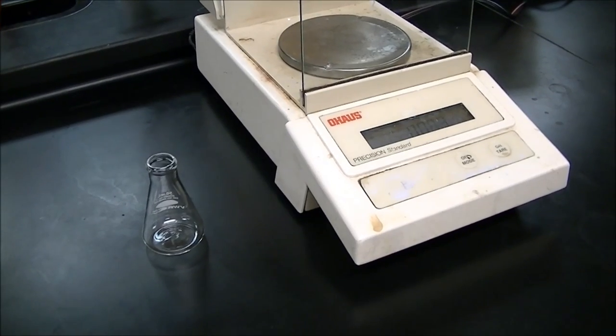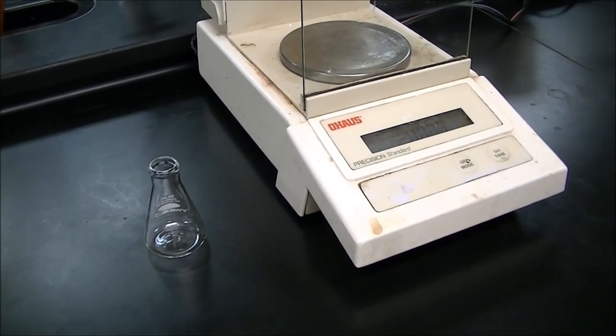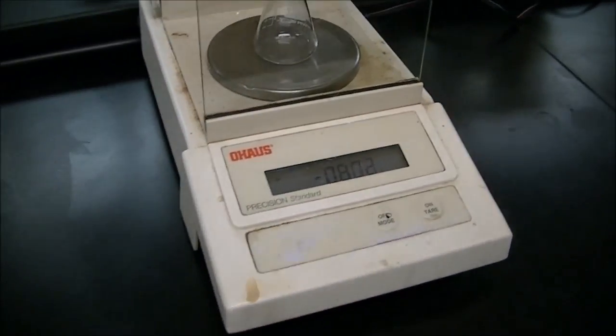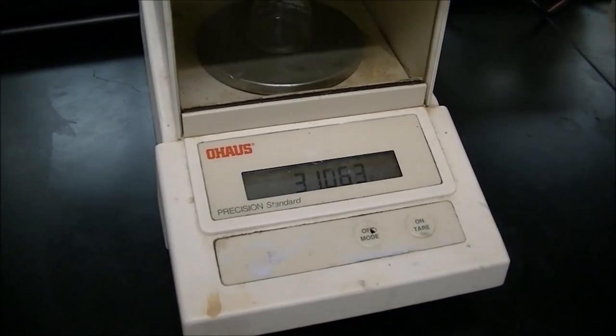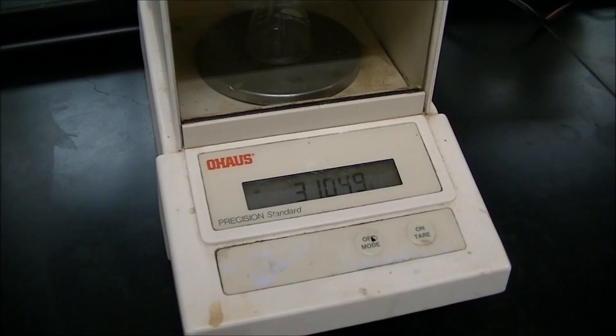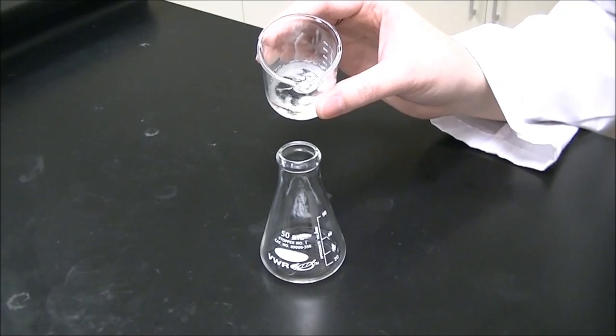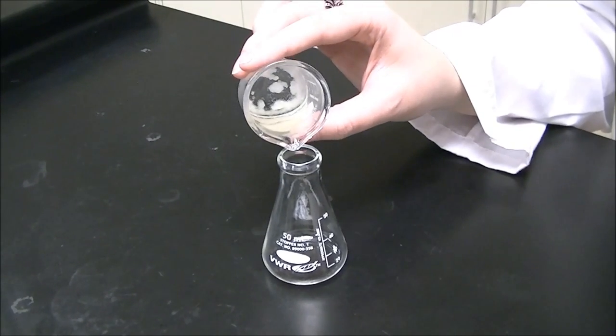Now you'll tare the Erlenmeyer flask by putting it on the scale and recording its mass.